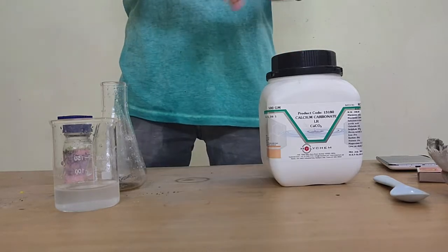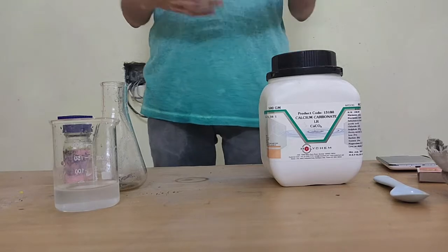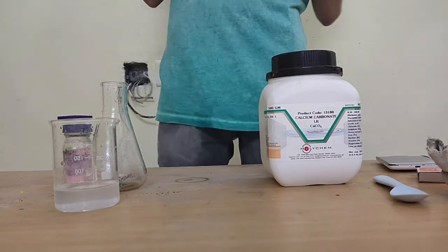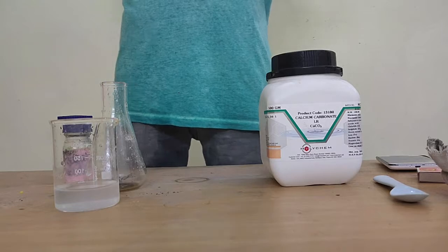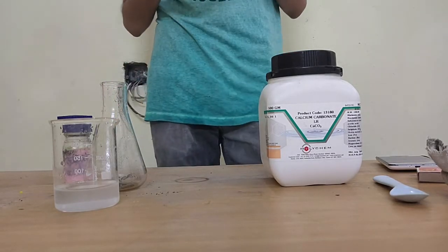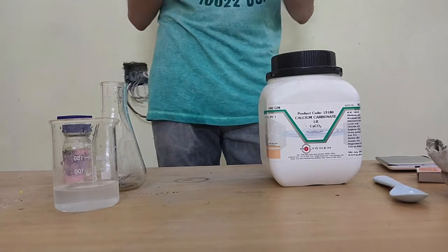So for today we will be looking at how a certain type of salt will interact with an acid. The type of salt we are looking at today is called carbonate salt. If you've seen chemical equations, some of them have CO3 in them, right? For example, CaCO3 or Na2CO3. So those compounds are called carbonates. They're a form of powdery salt.